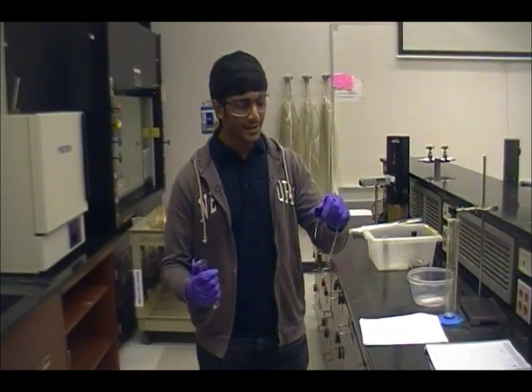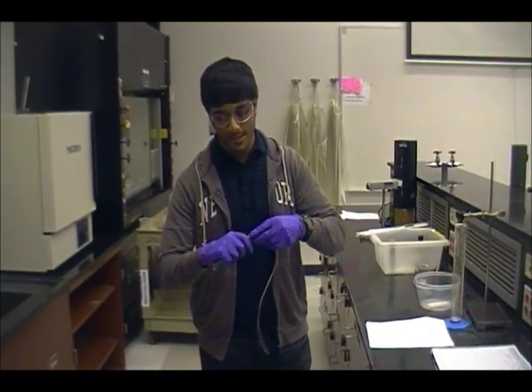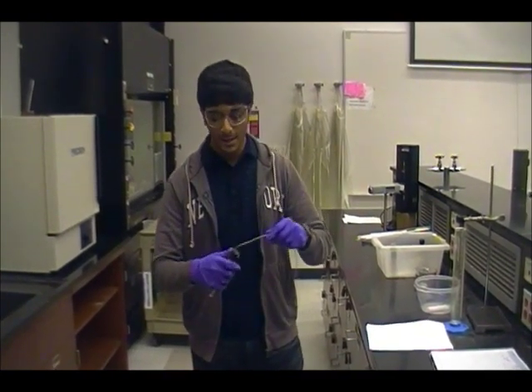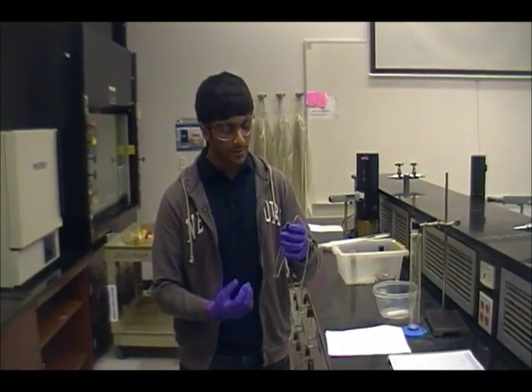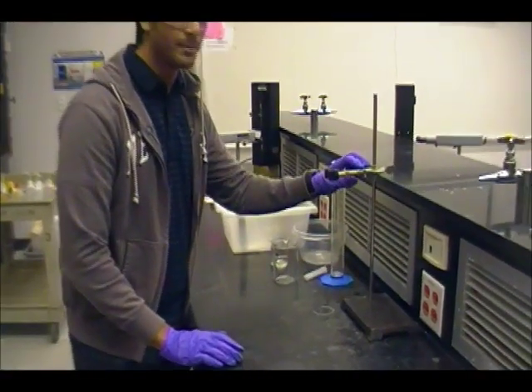We got this new black neoprene stopper over here, and we're going to make sure we put it on the test tube very tightly. The reason we want it on there very tightly is because when you add the hydrochloric acid with the syringe later on, the pressure in here is going to become so great that the stopper could potentially pop off, and if that happens, you're going to have to repeat your trial all over again. Before we proceed to the next step, you want to make sure that you have a ring stand and a clamp set up just like this.